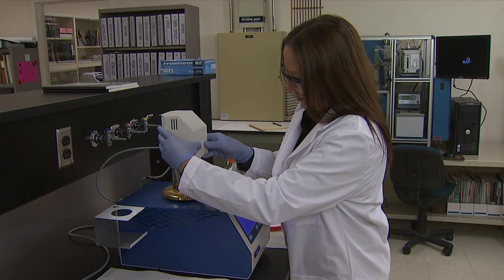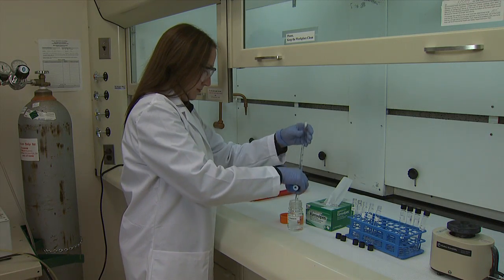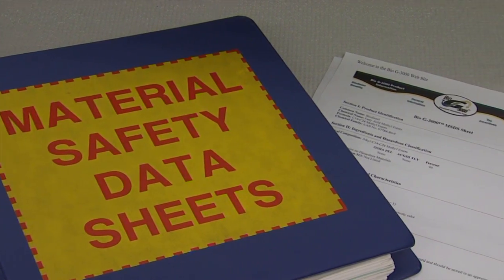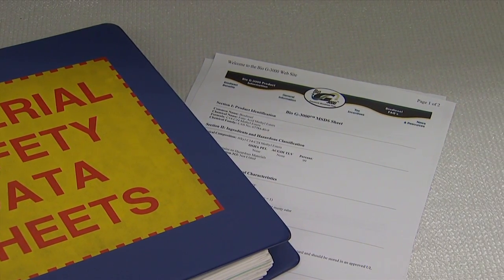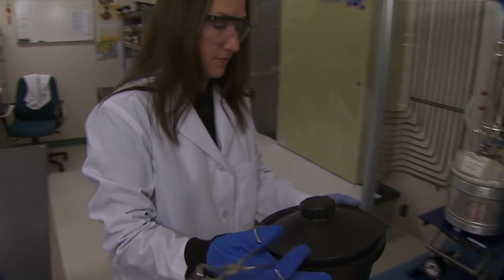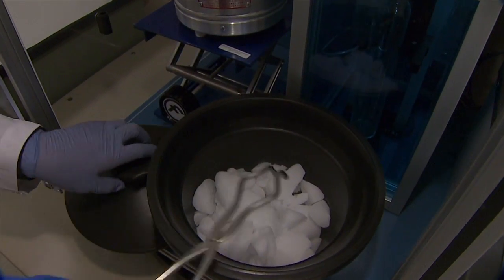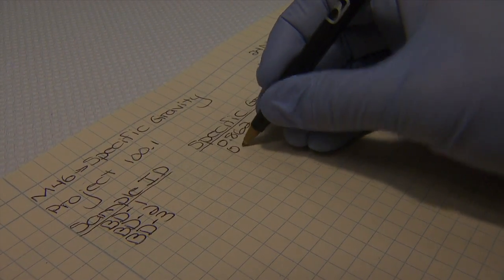Some of the recommended guidelines include: follow safety precautions at all times; consult the material safety data sheet for detailed information on the chemical substances related to the method; wear the appropriate personal protective equipment for handling chemicals and instrumentation; and record data at the time of observation.